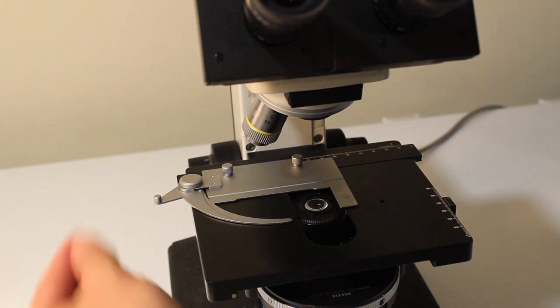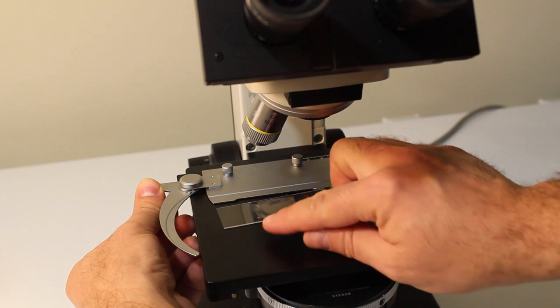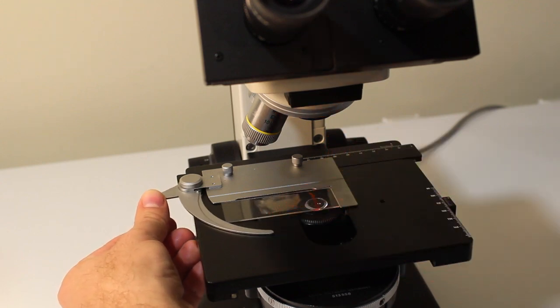So to put a slide on the stage, you want to draw back on the clip, put your sample onto the stage, and then put the clip back into place.